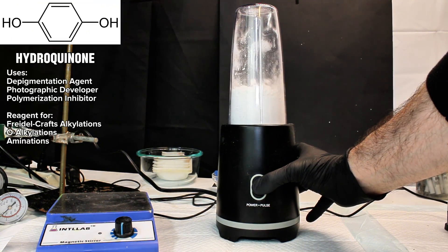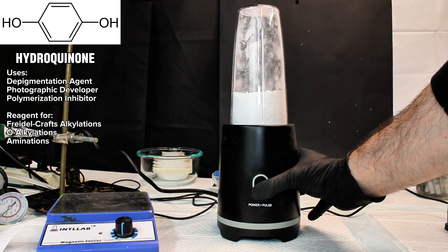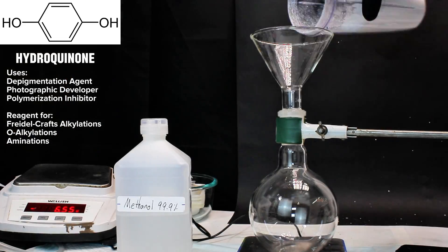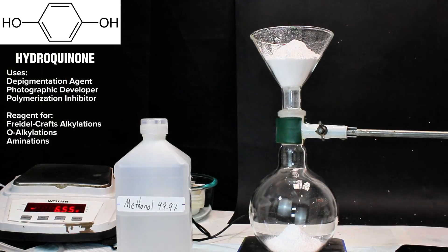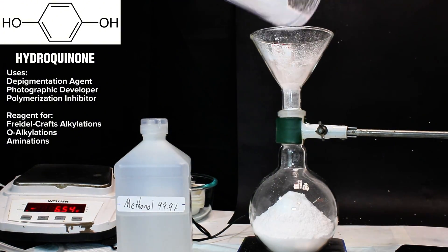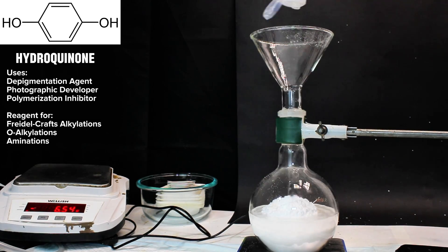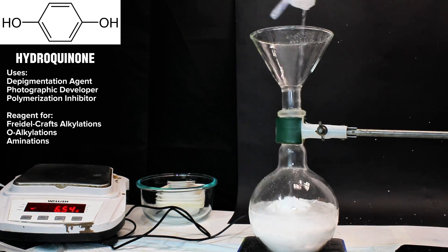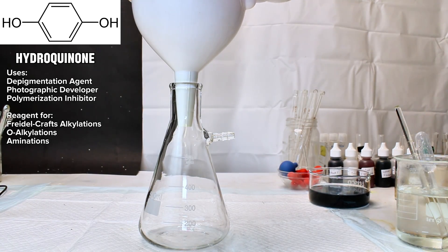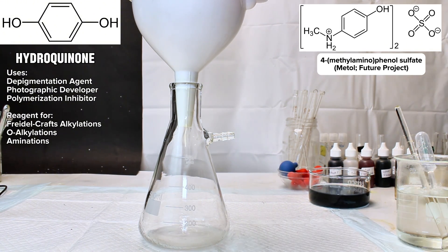hydroquinone on the other hand has a wide array of uses. For example, hydroquinone has a bleaching effect on human skin, which has led to its use as a treatment for hyperpigmentation with over 800,000 active prescriptions in the U.S. Hydroquinone is also used extensively in classic photography, easily undergoing amination with methylamine to make the photographic developer Metol, which is one thing I plan to do with this chemical.